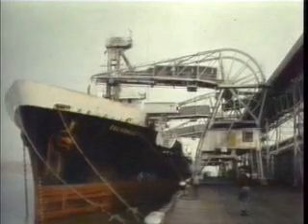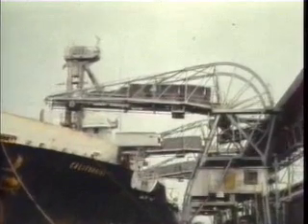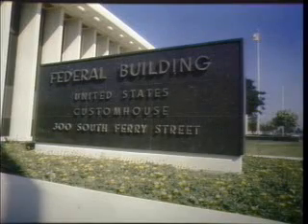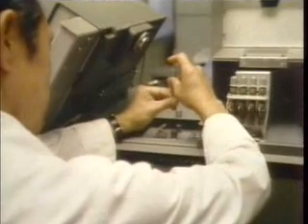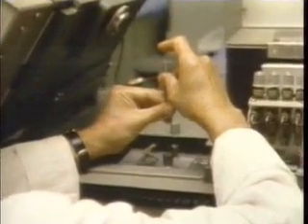Foreign ships unloading materials at any harbor in the United States must have their cargo cleared through customs. U.S. customs officials use many different techniques to determine the composition of substances. One of the most widely used is a technique called gas chromatography. Samples of the substance are taken to the lab where they are analyzed.